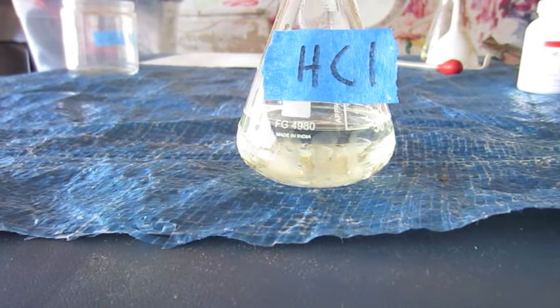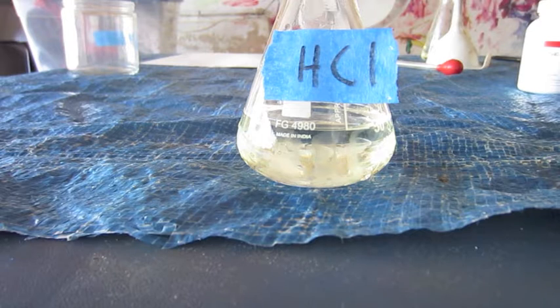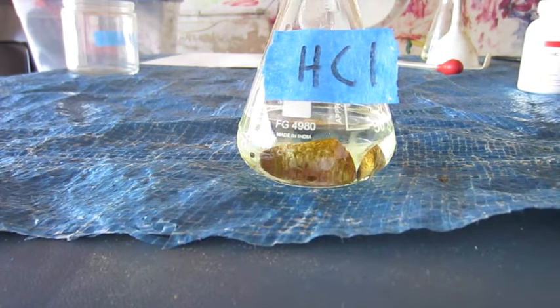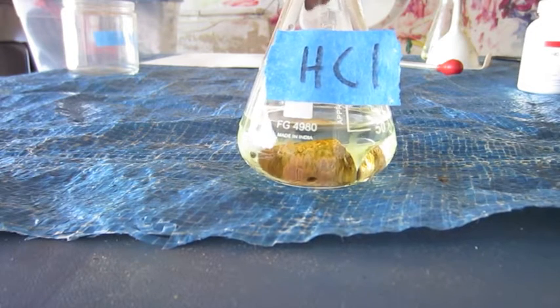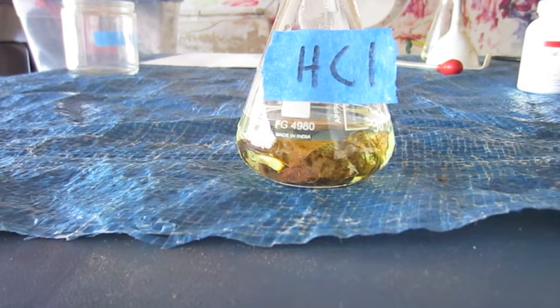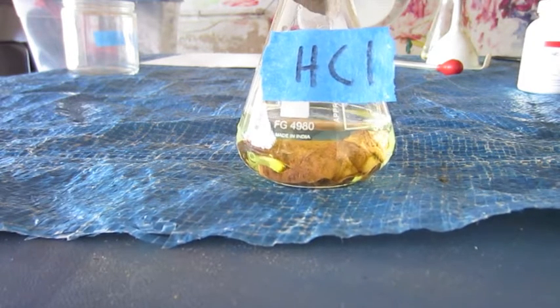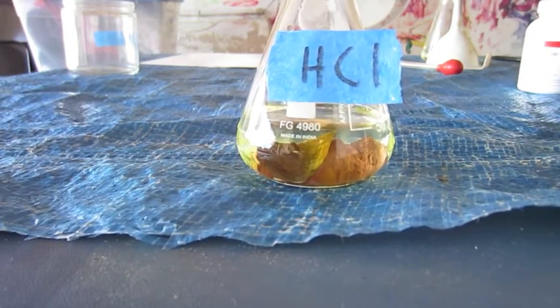Okay, we're now going to put copper in the acid that did in the zinc, and we'll see how it holds up. There we go, copper and hydrochloric acid, and you can see there's a little bit of color change at the beginning, but that is just because the acid is reacting with the oxides and hydroxides on the outside because they were old pieces of copper, excuse me. But after that is done, as you can see, there is no more reaction whatsoever.